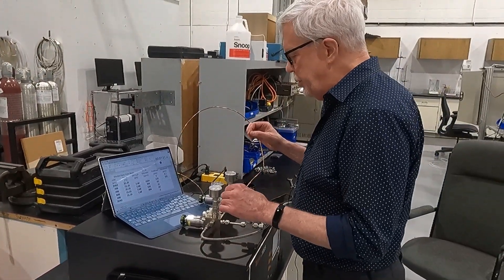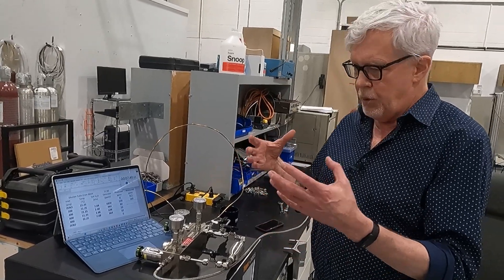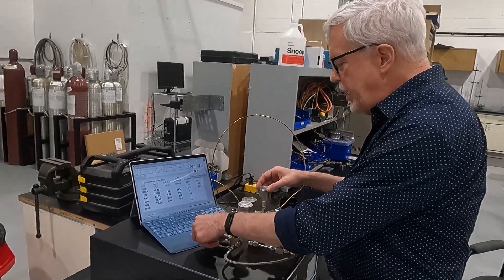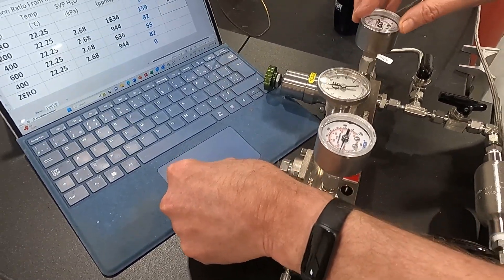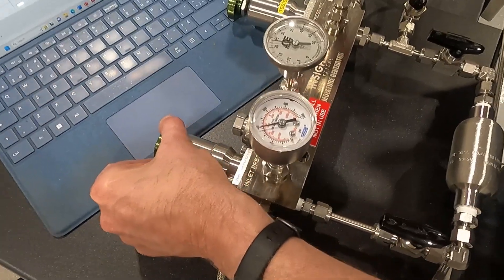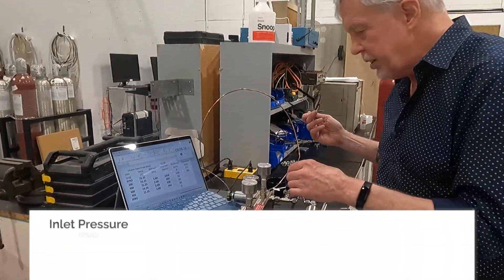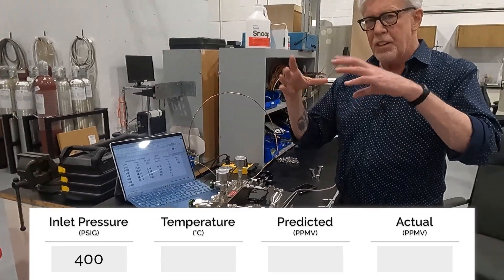Now, one of the other things we'd like to test is not only does the analyzer respond to a target concentration, but is it linear across a reasonable concentration range? Currently we have two points: zero and about 160 ppm. If I change the inlet pressure regulator — I'm feeding this with about 700 pounds — I'm going to change my pressure from 200 psi to 400 psi. This is my next calibration point. The accuracy with which we set the pressure and temperature is important for these measurements, so I'm checking that's about 400 pounds. I changed that around the eight minute mark, so we'll give it about three to four minutes to equilibrate.